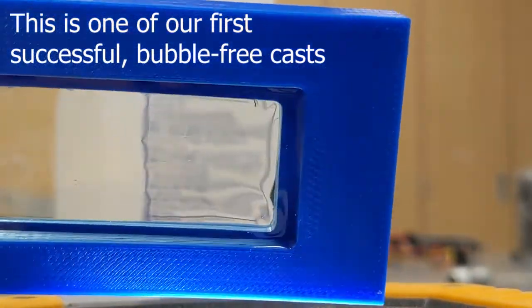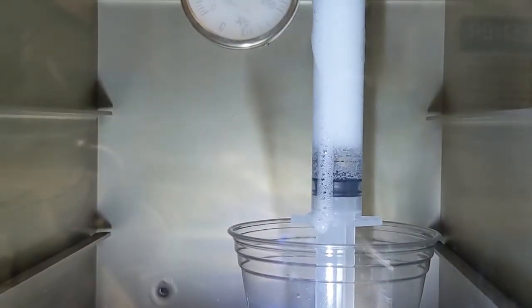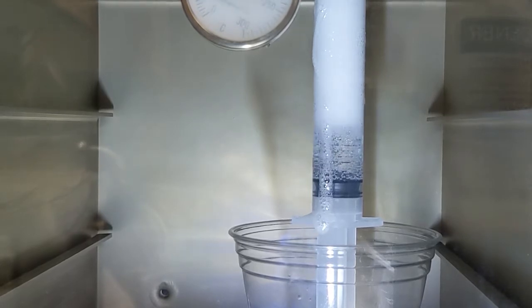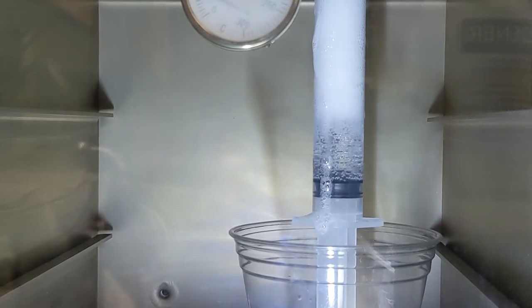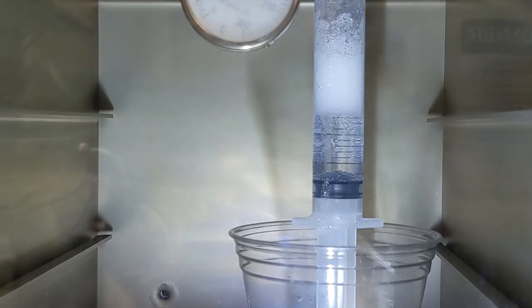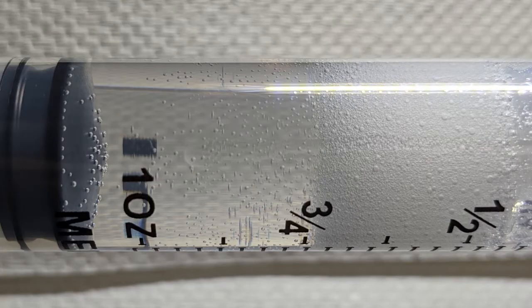Just for the record, we tried using a vacuum oven, and this is what we got. This is an actual time lapse of 30 minutes of the vacuum oven operation, and you can see that the bubbles do rise. Forget about the mess; it makes a lot of foam, but the bubbles do rise very slowly. Now we're decompressing, and you can see that the bubbles are shrinking, but they didn't really leave. They just shrunk. So the vacuum oven didn't really work for us, and it exceeded the cure time of our resin, so the bubbles actually got frozen inside.